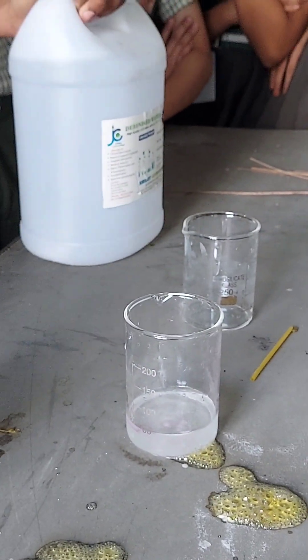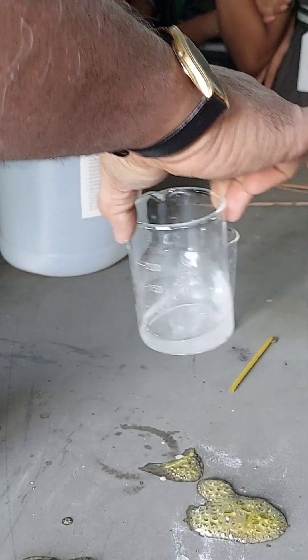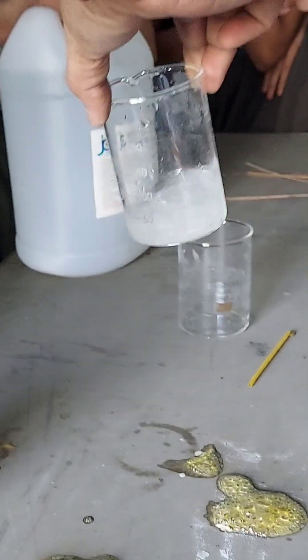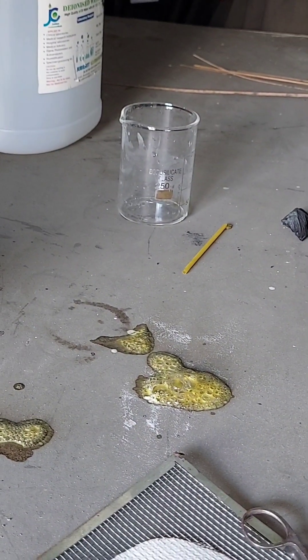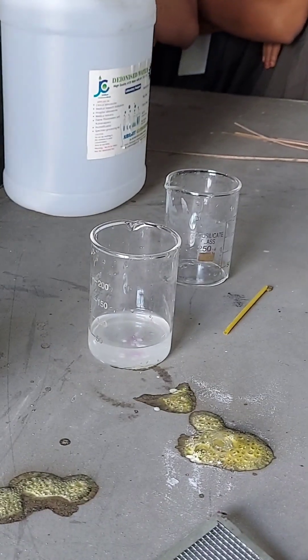So now what has happened here? Now it is neutralized. So from colorless to pink, then pink to colorless. The solution is now neutralized.